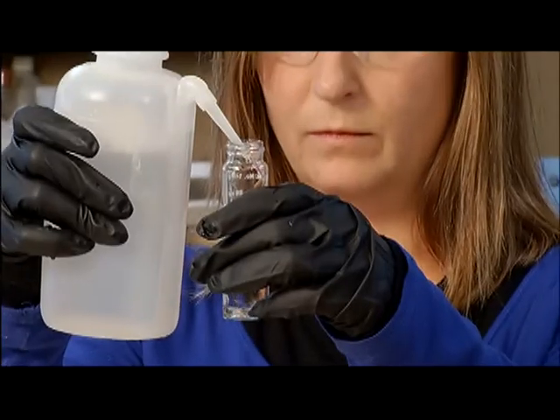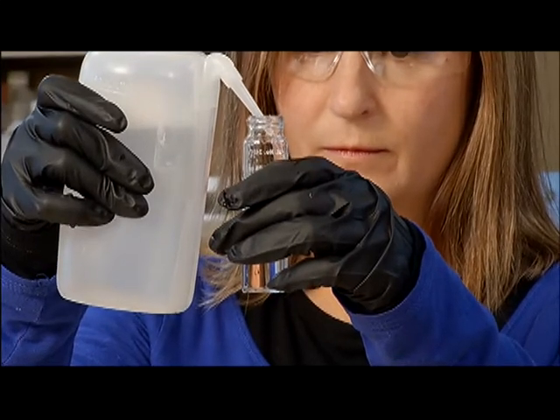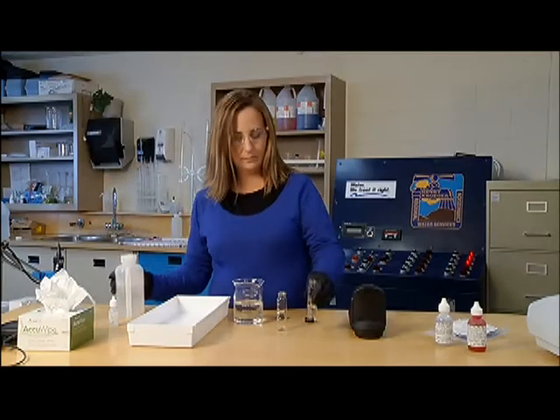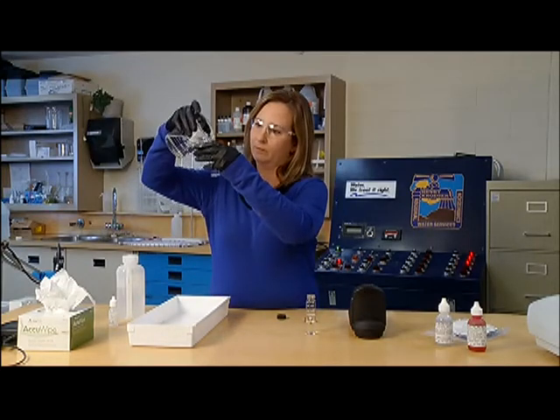The operator then uses ten milliliters of deionized water to make the blank for the test. Ten milliliters of the sample are placed in the second sample cell.